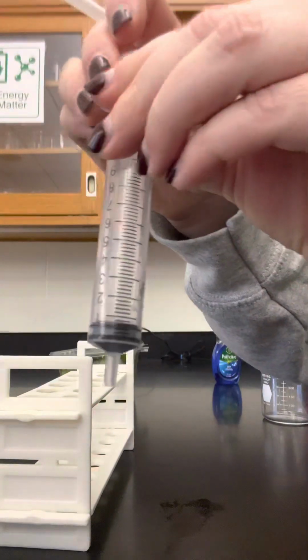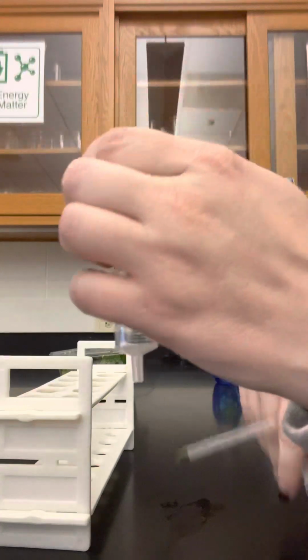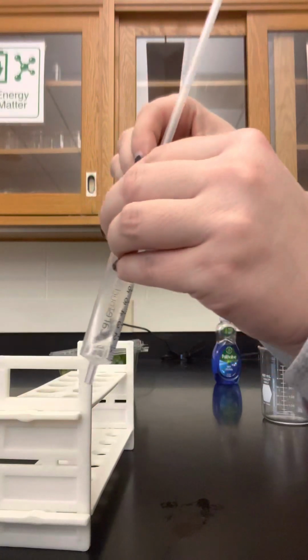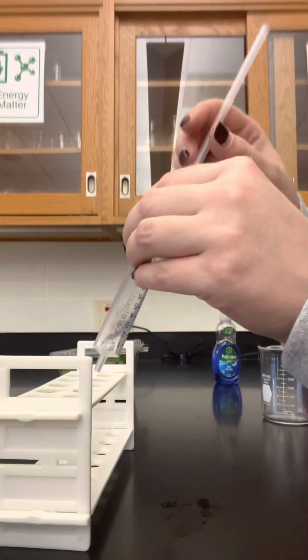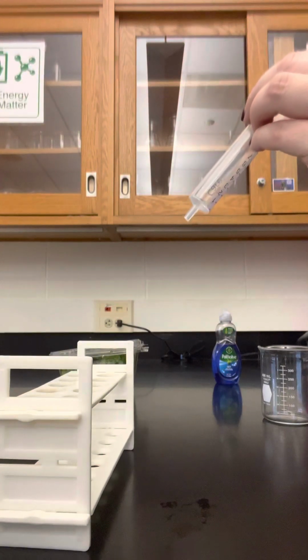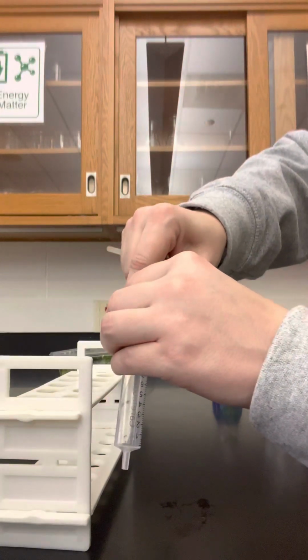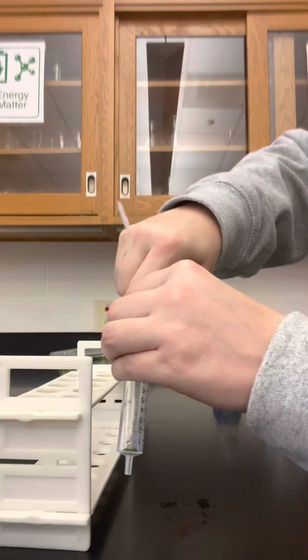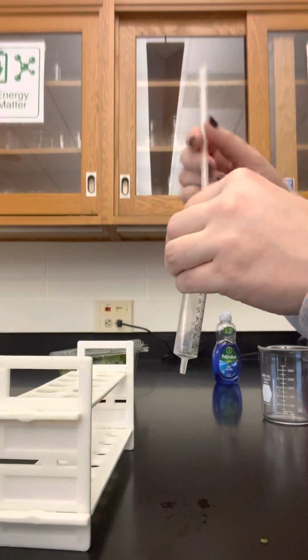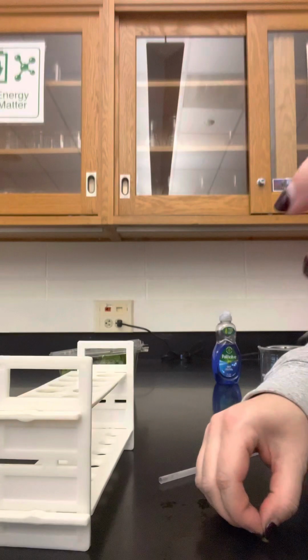Next, we are going to insert them into the syringe. So this is the 10 discs for one syringe. Now, you can either squeeze these out like a tube of toothpaste, or the much more enjoyable method of extracting these discs is to just blow in the straw. And they might not come out. But there we go. Loosened them up a little bit. You got to get them out. Some went flying.